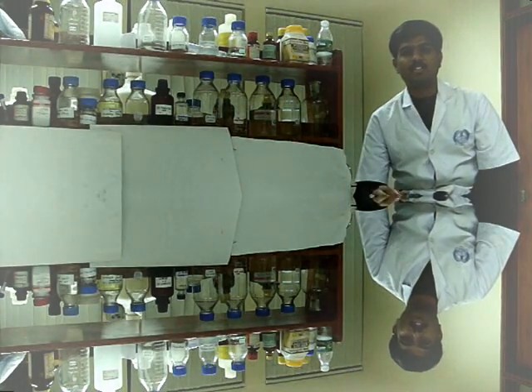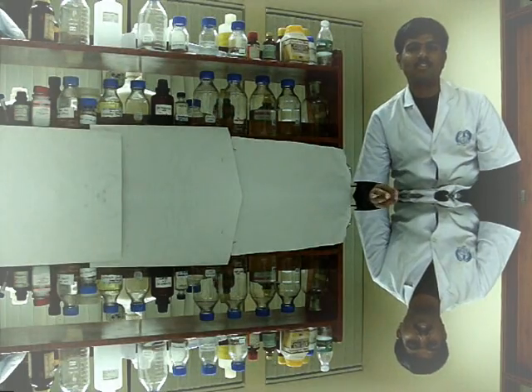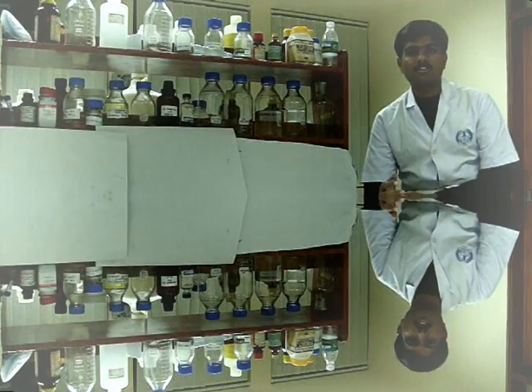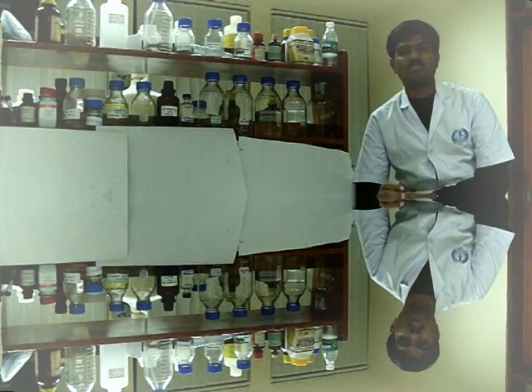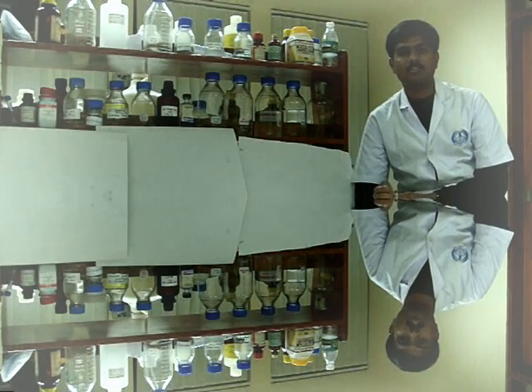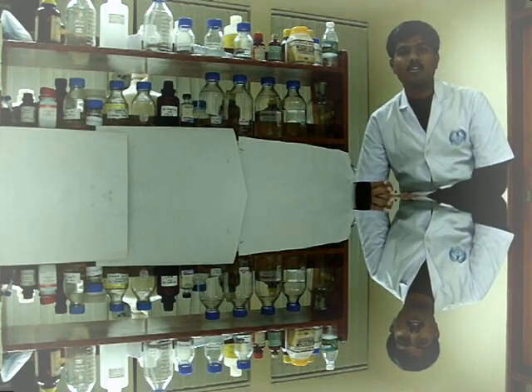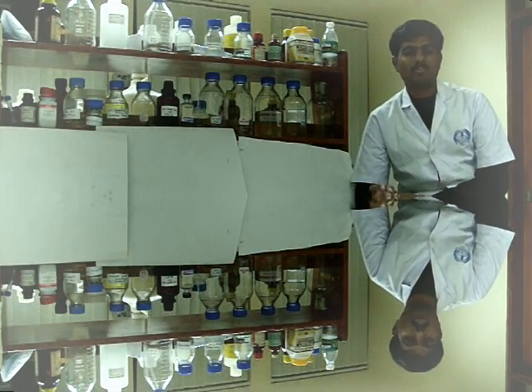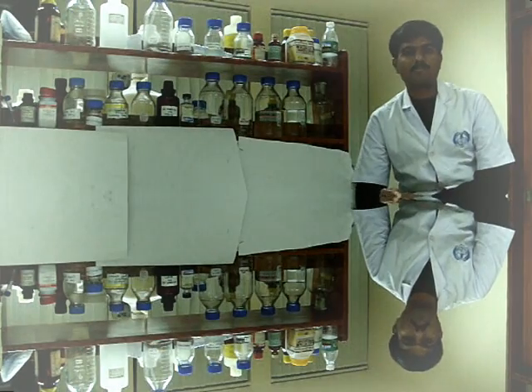Hi, this is Raghavendra, giving a demonstration on RNA isolation using the Trizol method. RNA, ribonucleic acid, which is one nucleotide different compared to DNA, is very much essential in protein production in the central dogma of life.